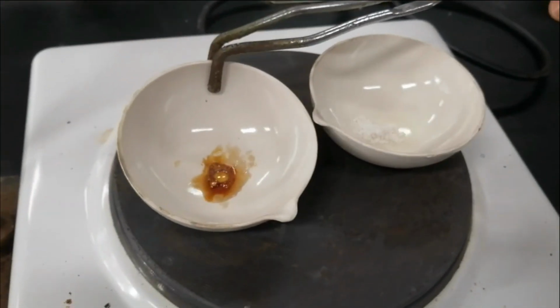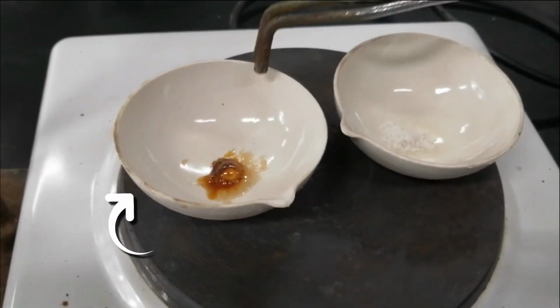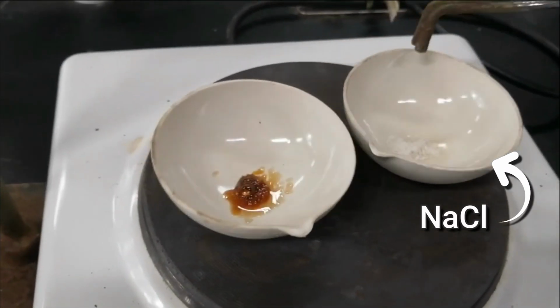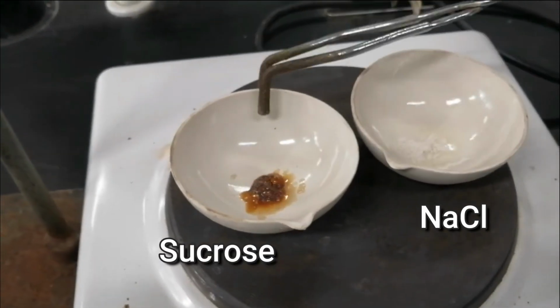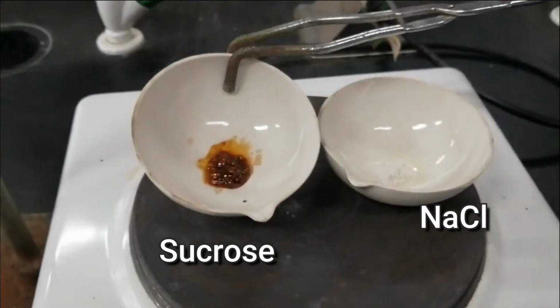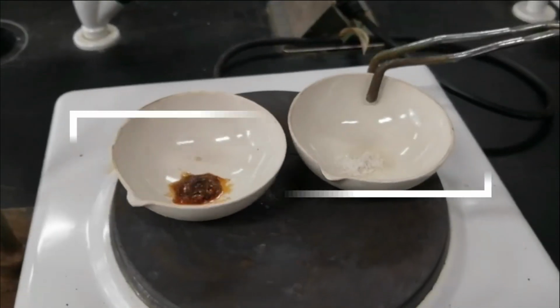Ito yung setup. So, tignan nyo. Sucrose yung nasa left and NaCl yung nasa right side. So, nagmelt na yung sucrose. Wala pa ring pagbabago yung NaCl.